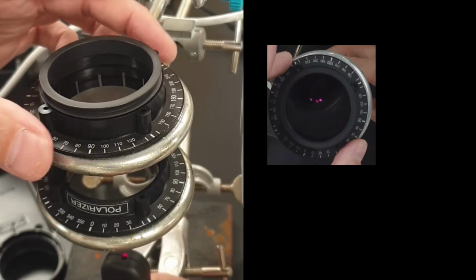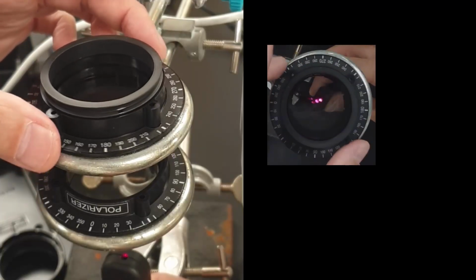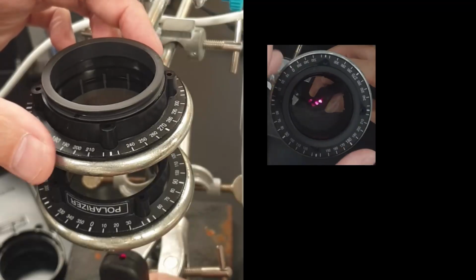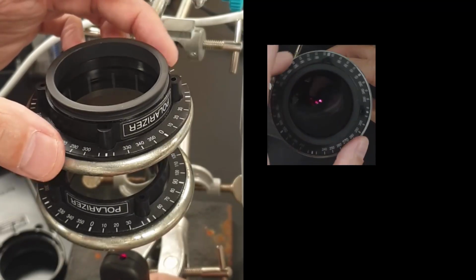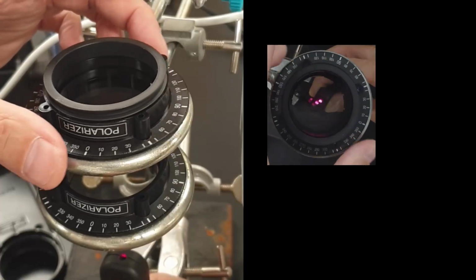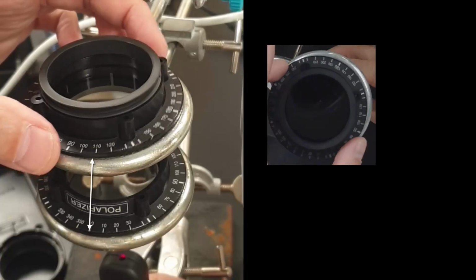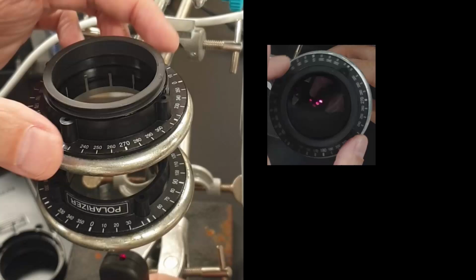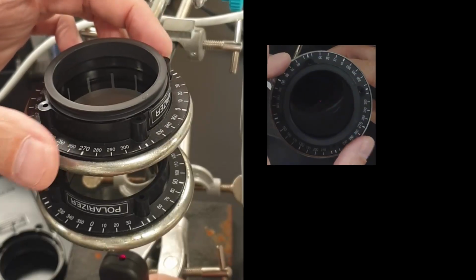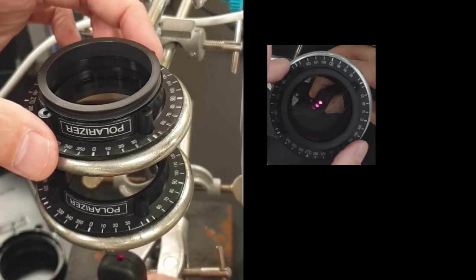And so I'm just testing it, so you can see that when I turn this at 90 degrees, the light completely cuts out. So that's my control, and it does work. It's about 10 degrees off, which is important because I'm going to try and take a measurement now. And so I just keep turning that. You can see when it's at 90 or 270, it blocks out, but it's out by 10. So I'll just remember that, and minus 10 from whatever answer I end up getting.